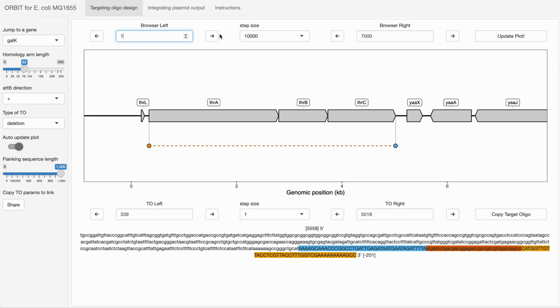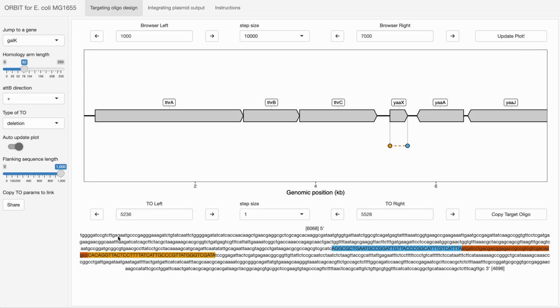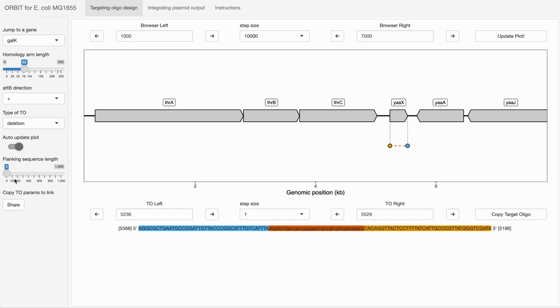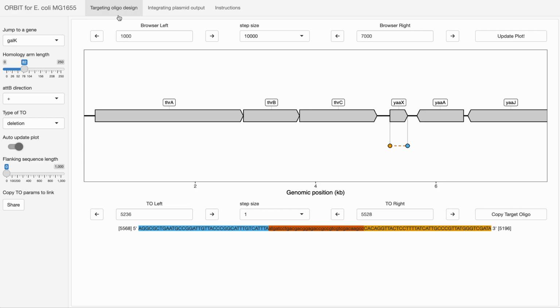But if we just go to 1000, then I will update. And this is the flanking regions around your targeting oligo that you could design a primer in. So if you really quickly want to do that, that's fine. The integrating plasmid output, of course, is going to be a more useful, highly annotated version of that.